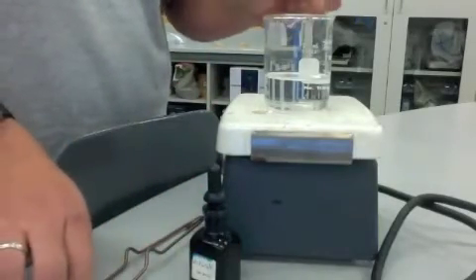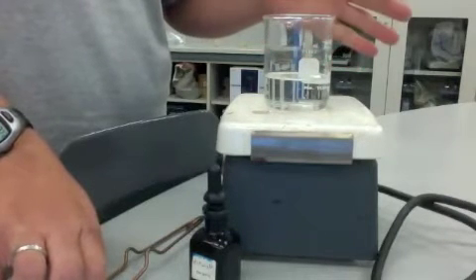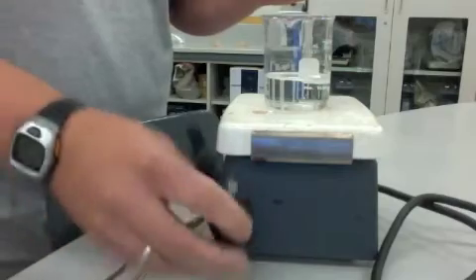Then you wash off your sample like you do with the gram stain, just with water. All the spores should be stained this malachite green color.